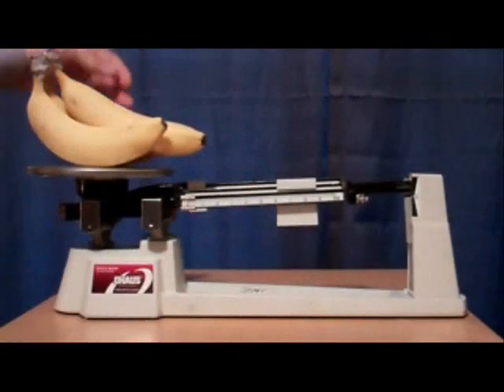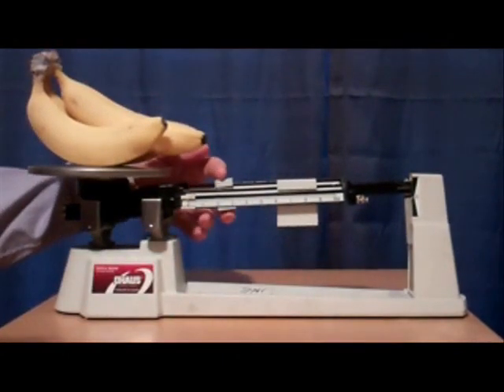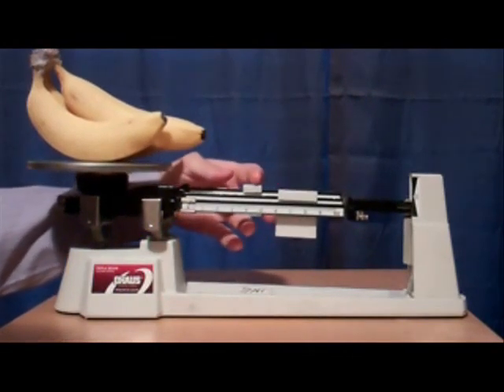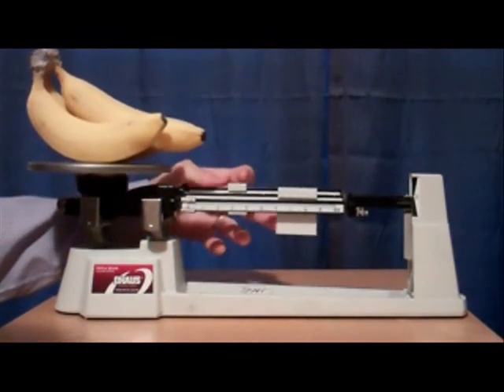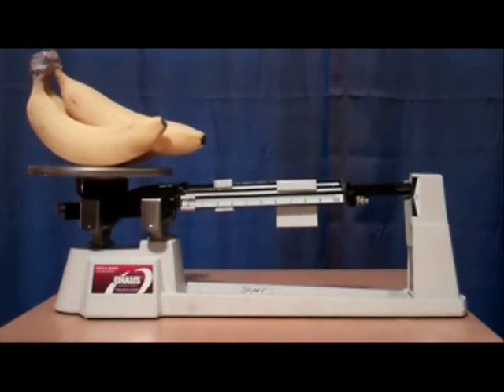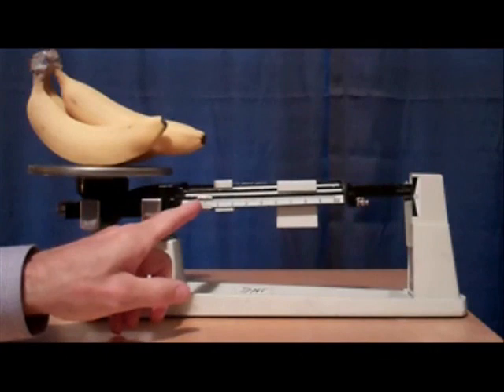And it's now in the hole for the 400. I can do the next size rider, working in the back row. I need to back off. And now I can work with the smallest in the front.